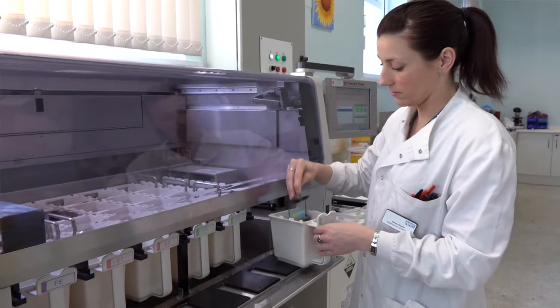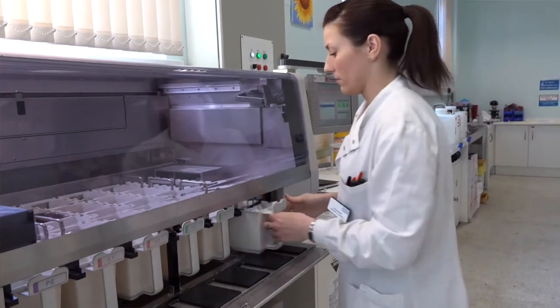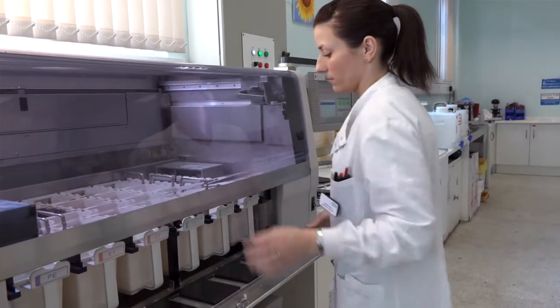The glass slides are placed into a hot oven to melt the wax, leaving just the tissue on the slide. We can now start the staining process.